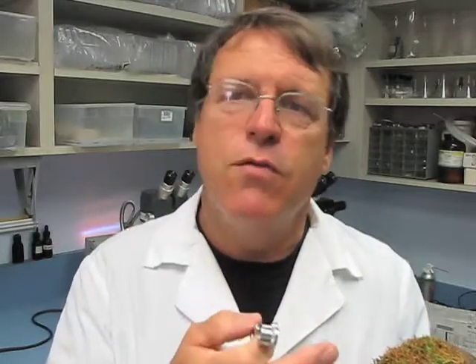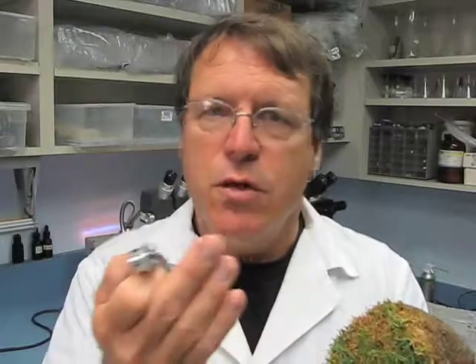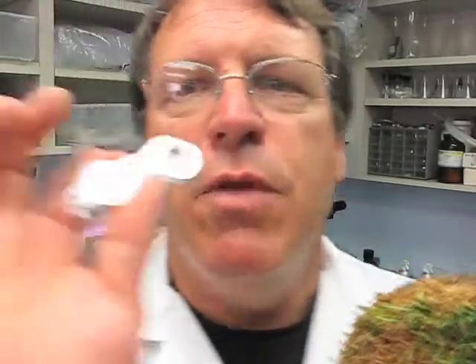Now, if we take some of those samples back from the field, there's a variety of organisms that we find on the samples. There can be anthracnose or some other stress-related organisms. I'm going to show you an organism that can be confused for anthracnose. It's probably not the primary pathogen, or it's like anthracnose. It comes in when the plant is stressed, and we'll describe the details of this organism as we go through a diagnosis. But let's take a look at what you'll see with a hand lens again with this organism.